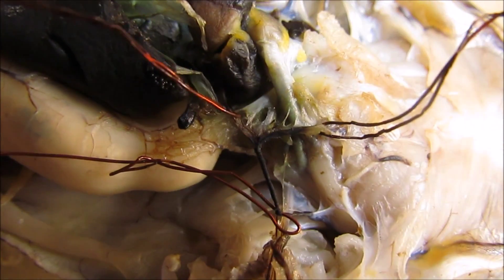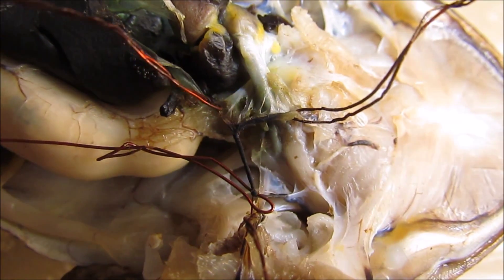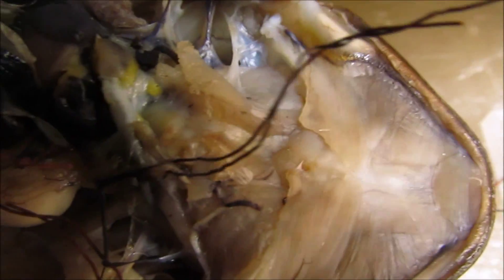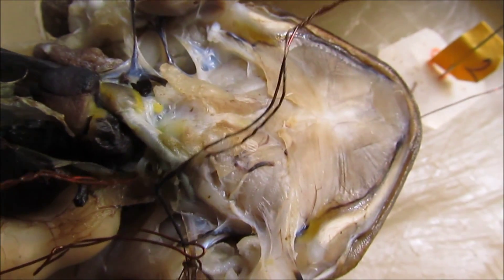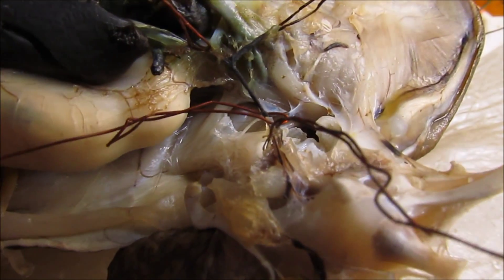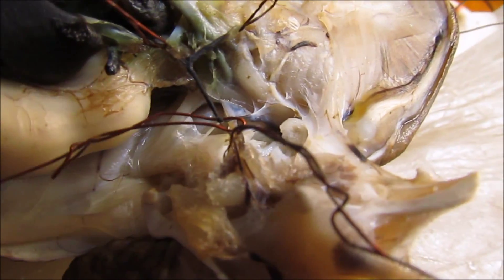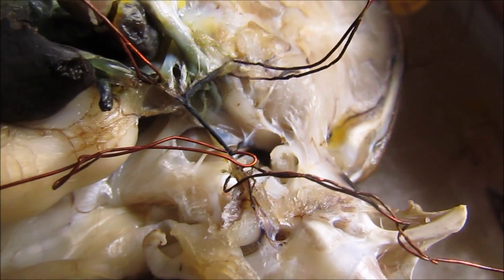So this one is the precaval vein, and then the external jugular vein — this one. And then the innominate vein. Then number four is the subclavian vein, this one, near the innominate gap — it's more yellowish.